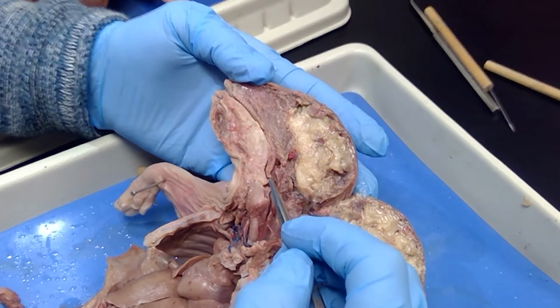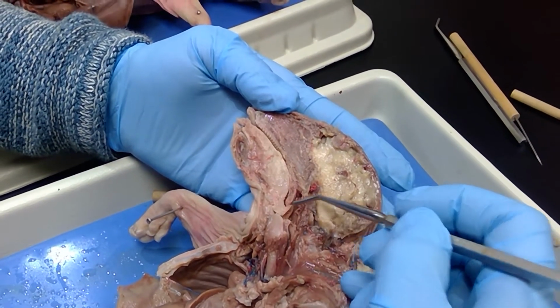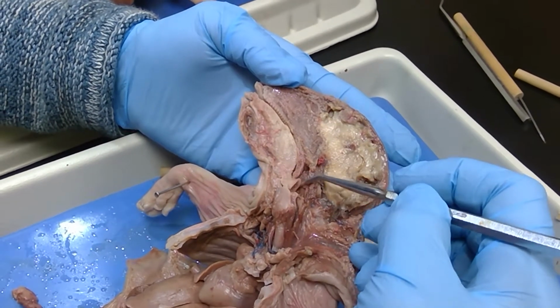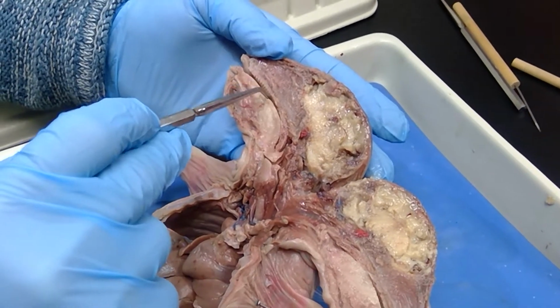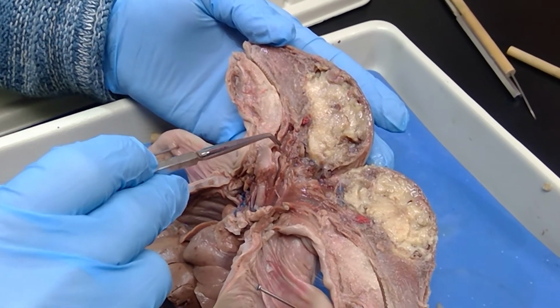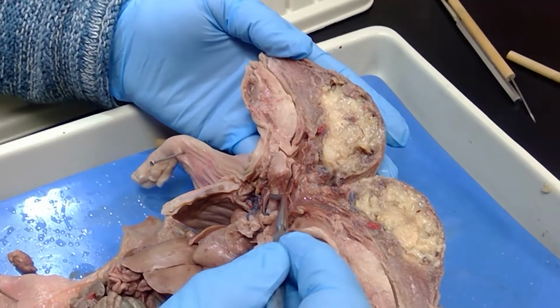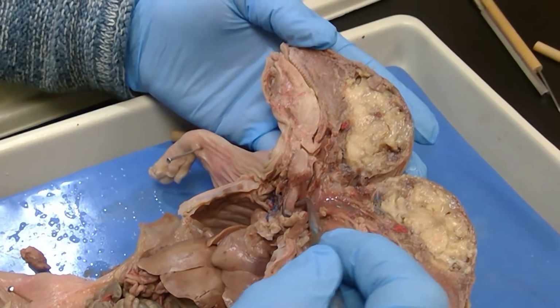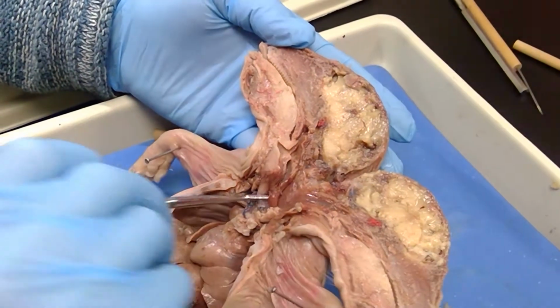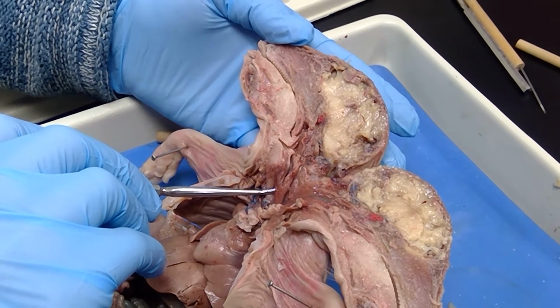Okay, look at this structure right here. I think you're at a good angle of seeing it too. See how it has that little curved round structure there? And that looks like the esophagus on the model. That's actually the epiglottis. So whenever you swallow food, food would be here in the oral cavity, it comes down, and whenever the tongue pushes the epiglottis down, it closes. And see how it covers the opening of the larynx here? Mm-hmm. And the food would slide down to the esophagus here. This is the trachea. And this, I can't get behind it very well, but I saw it. That structure right there that's on top of the probe, that smooth muscle, that's the esophagus.